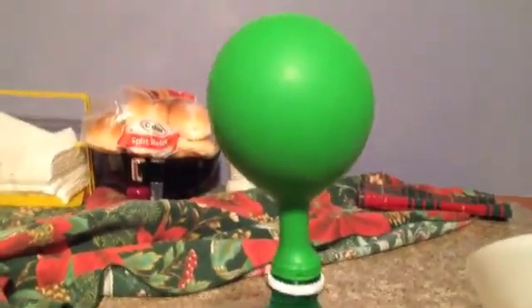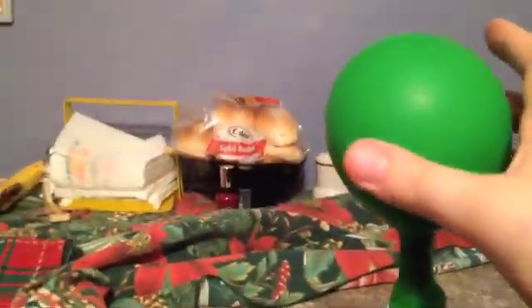So we got more hydrogen peroxide and manganese dioxide, and this time I tried to fill up a balloon with it, and it sort of worked. I mean, this balloon is very tight — I just think it's not strong enough. Thanks to Cameron for supplying me with this bottle. It's pretty cool, I just wish it could go a little bit more. This is, as I've explained, an oxygen balloon, because of the reaction that takes place with the MnO2 and the H2O2. Thank you.